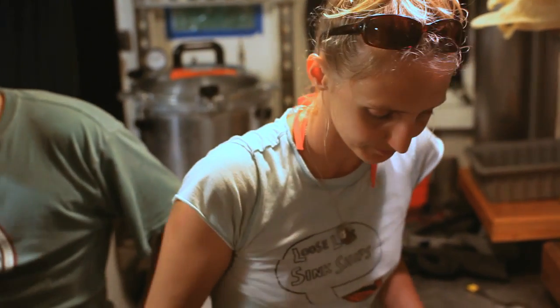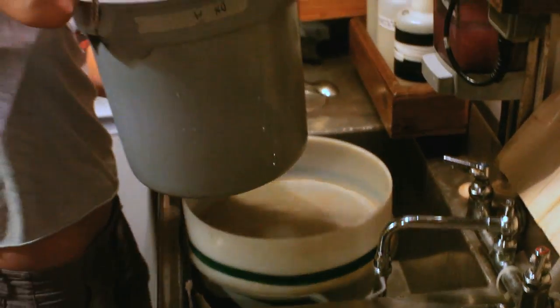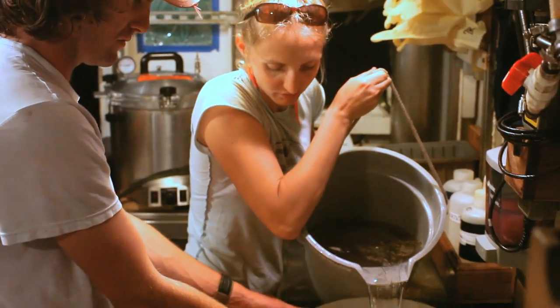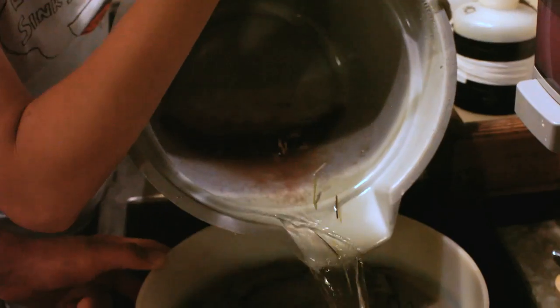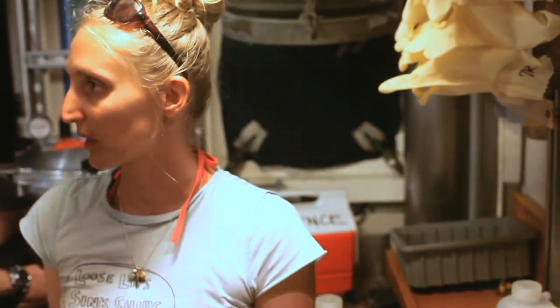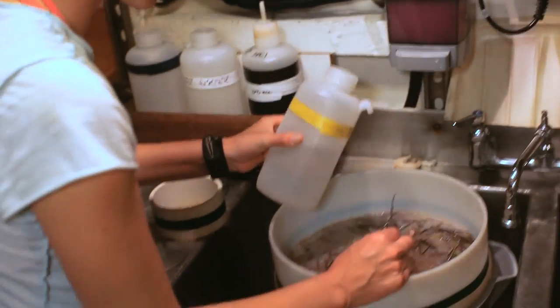Like tons of them — all the red ones. So now let's talk about the fun part. This is our pristine sample, right? Let's take this. We just want to go slow. If there's lots of little medusas, the stem will fill up really fast. We don't want to break the mesh. Try to avoid putting all those red guys in here. We don't want plastic to touch other plastic because it's not sterile. We want to try to keep as much sterile as possible. We rinse everything well. We want to be quantifying the zooplankton later.